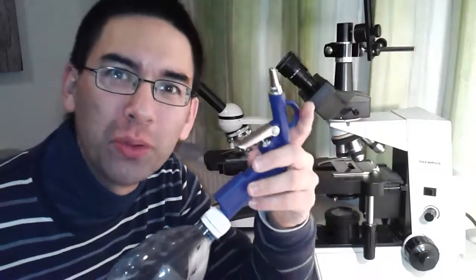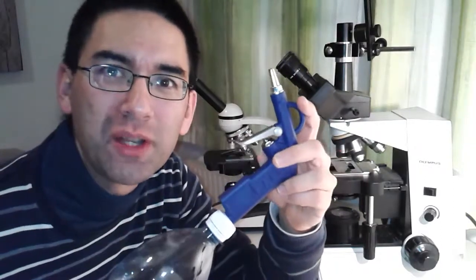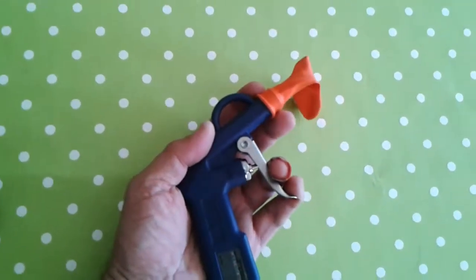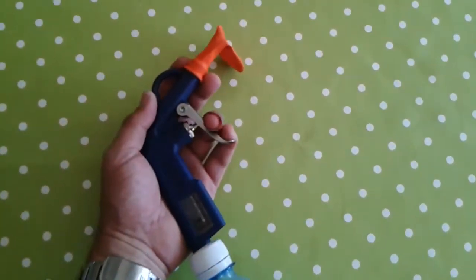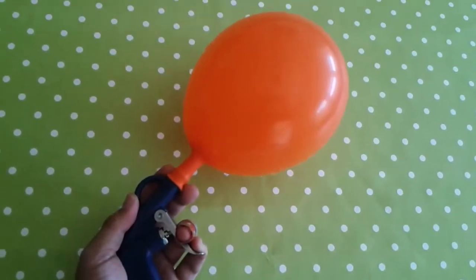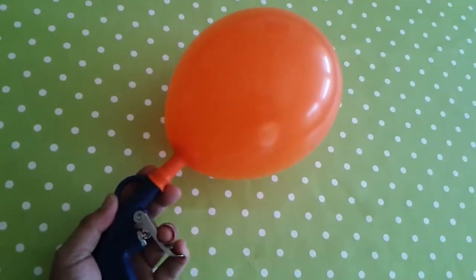So now I would like to show you how the thing actually works in real life. I'd like to show you some things in action, so to say. Okay, so let's try it. Let's try to blow up the balloon and see how much air there is in there. So that's basically the bottle. It's pumped up to 1.5 bars. And it's going to pop. Still plenty of air in it.